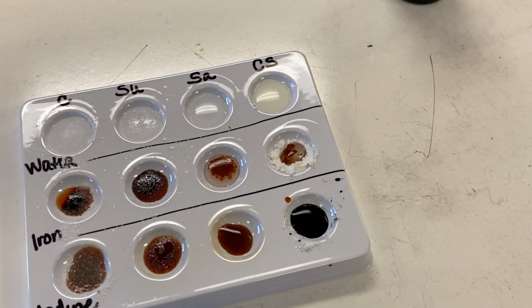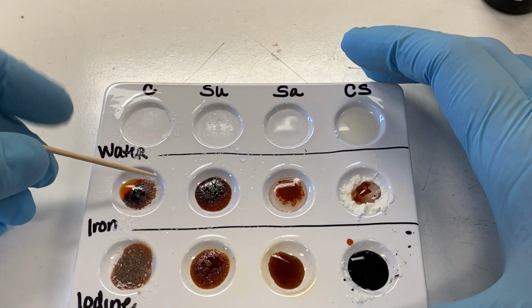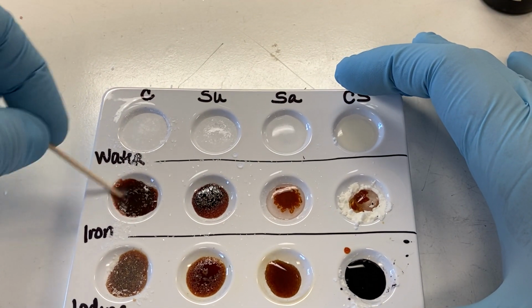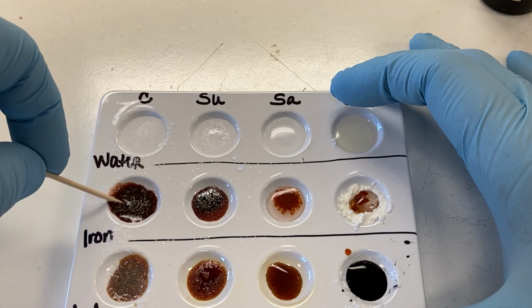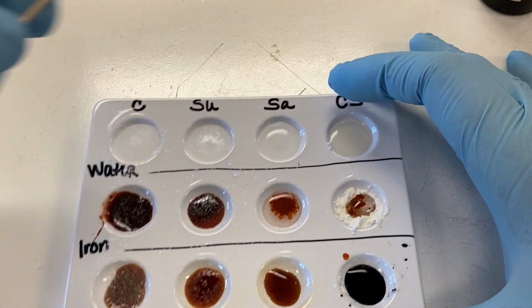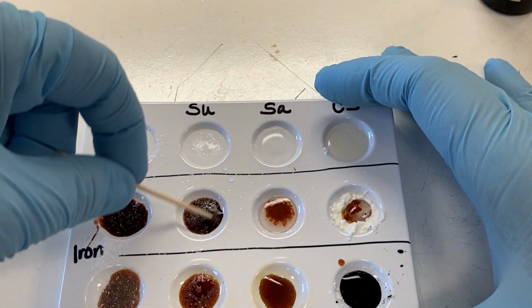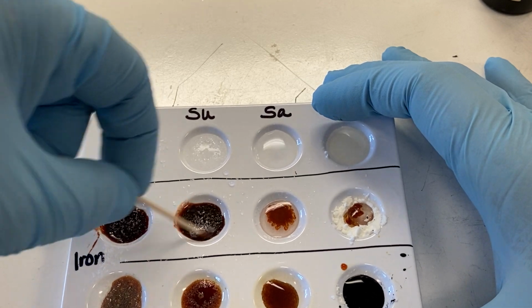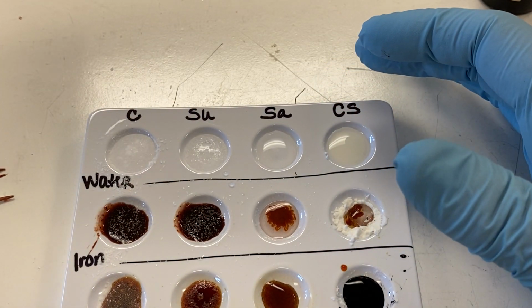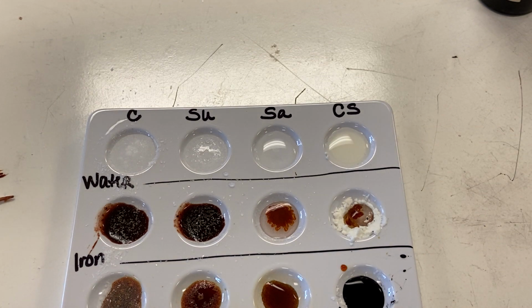So now let's look at our samples overall and see what we can see. So here's the control mixed with the sodium hydroxide and ferric nitrate solution. And if you look at these two, they are almost identical in color. And that's kind of the reaction that we were looking for. So based on this reaction that we have with those two being identical in color and having the exact same reaction, we can actually conclude that the sugar actually contains some of the aspirin.